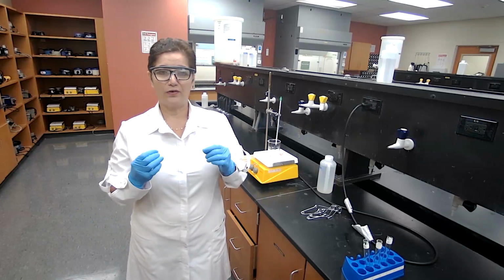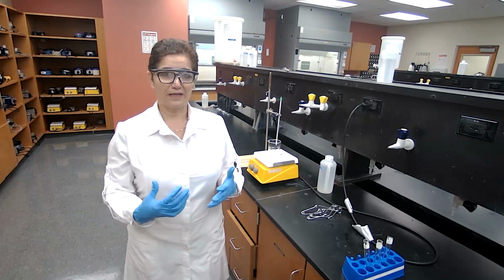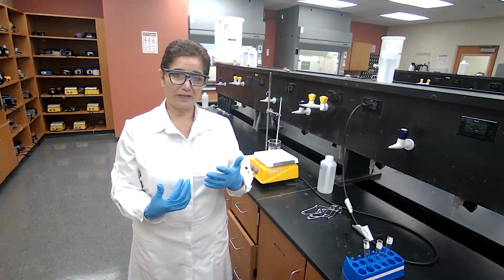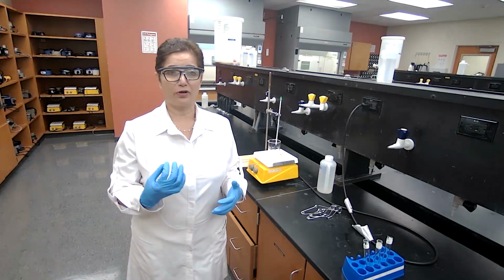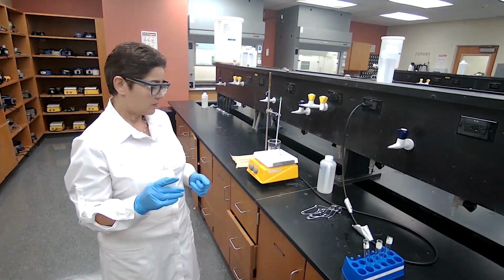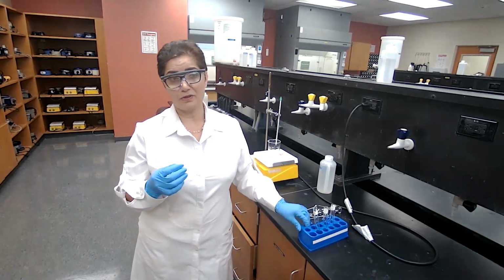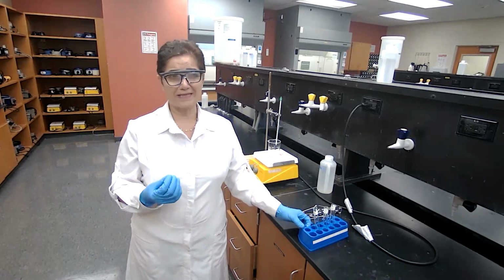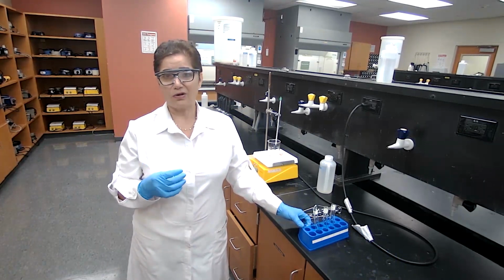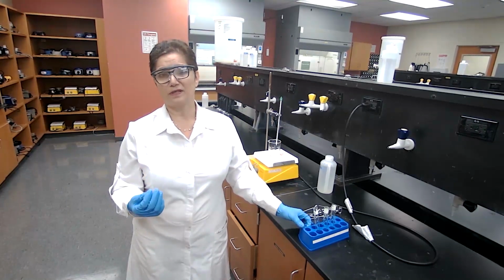For the first part of the experiment, I'm going to go straight to the procedure. I'm your lab partner and I'm going to perform the experiment. Since we don't have other groups, I'm going to make all 3 esters, A, B, and C. For ester A, we have methanol and salicylic acid. For the solid compound, based on the procedure, we are using 0.2 grams of the solid acid. For the liquid acid, which is acetic acid, I would use 10 drops. For the alcohol, all 3 are liquid, and I will use 20 drops of the alcohol.